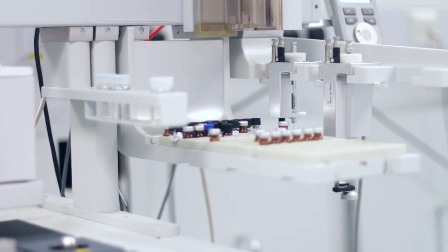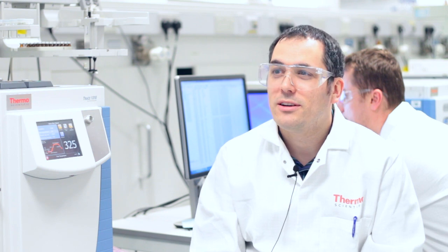Already what we're seeing is that increase in resolution — I'm very familiar with our Orbitraps on the LC side — so that increase in chromatographic resolution coupled with the resolution of the Orbitrap and the accurate mass are really giving us a lot more than we previously had. It gives us the capability to work out the structure of things, to look more deeply into chemical formulas and chemical structures in the small molecule space that we weren't previously able to do, and I think that's really cool.